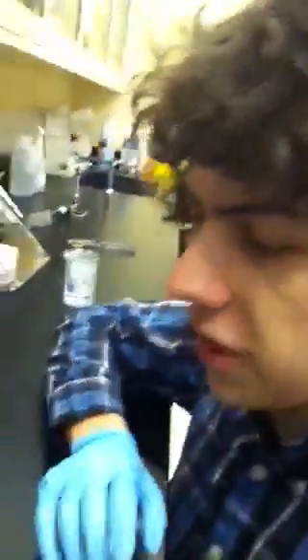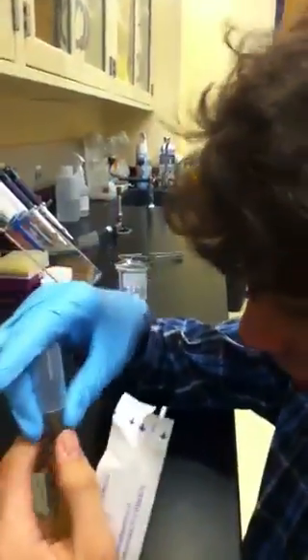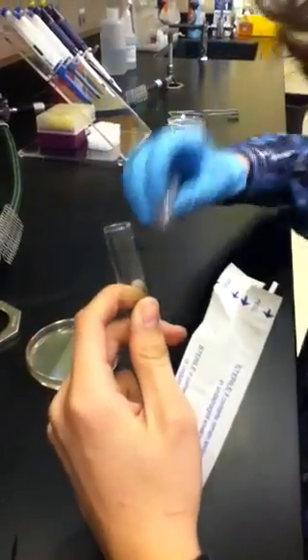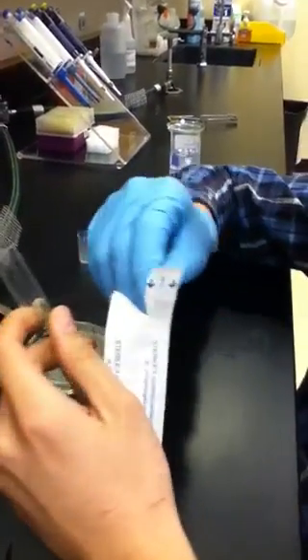Today we're going to be figuring out what antibiotics bacteria are resistant to, or which antibiotics bacteria are susceptible to. Here is our sample. We're first going to make a lawn on this plate. A lawn is simply a bunch of bacteria.